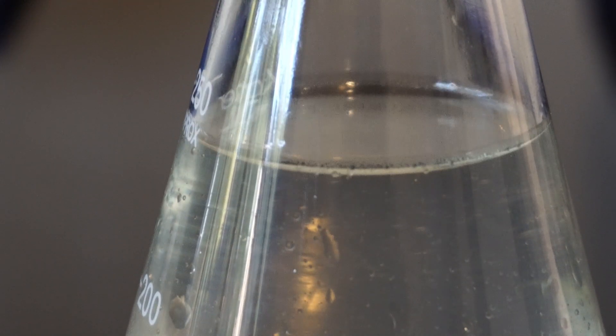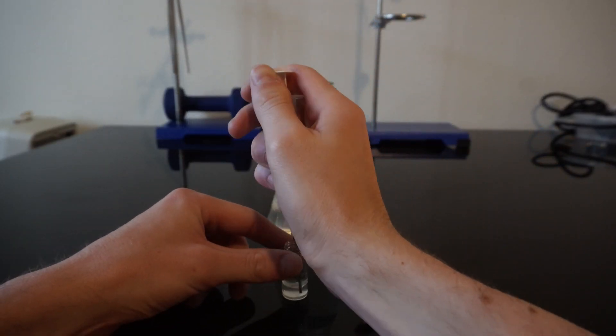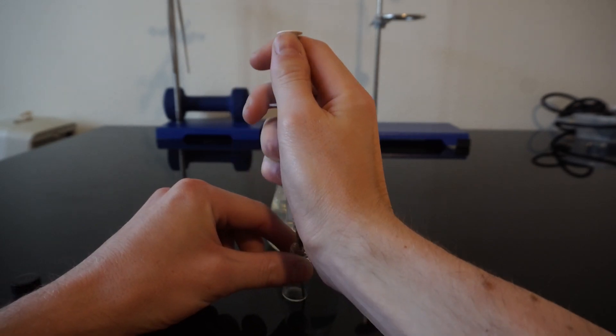At this point I repeat the process and let the water and the oil separate in my syringe. This works just like a very small scale separatory funnel.